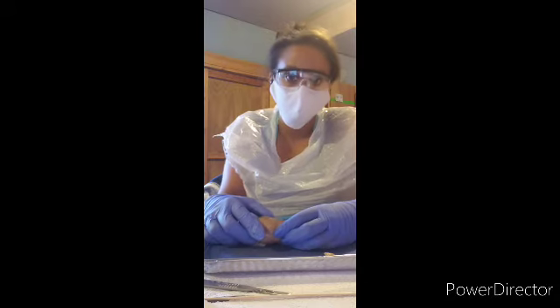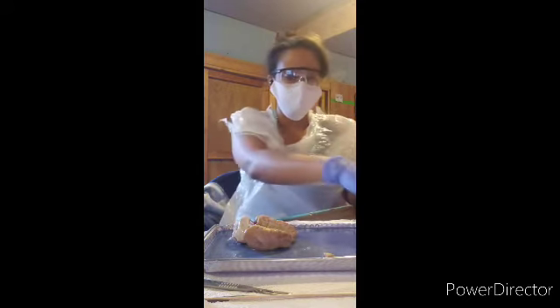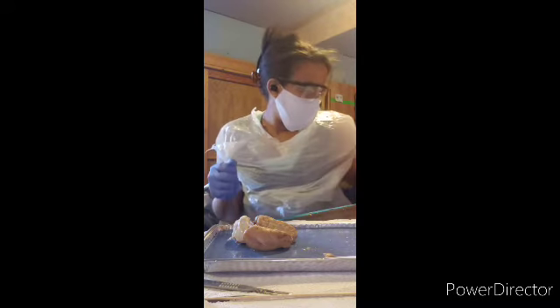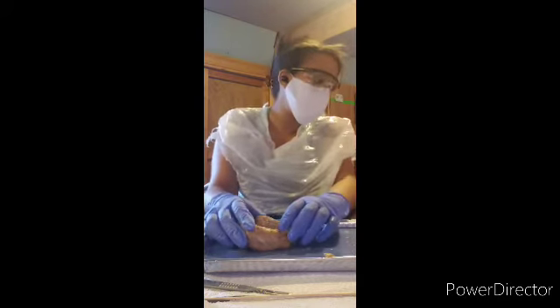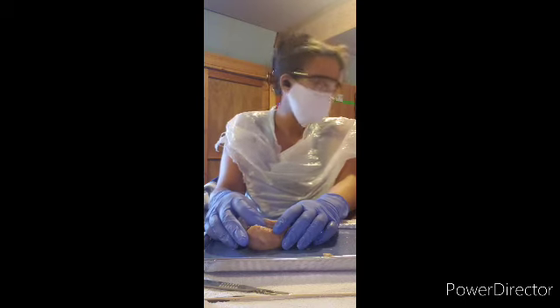I can't pronounce it correctly. Forgive me. But moving on, just gonna dab on the napkin. Corpus callosum, which is a collection of axons that extends along the medial face of the cerebral hemisphere.